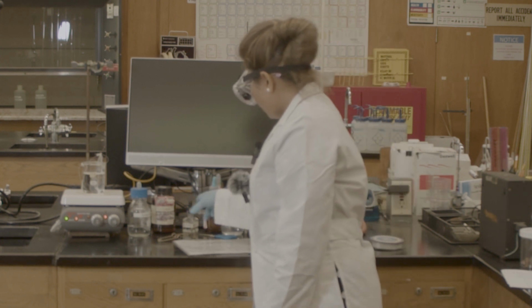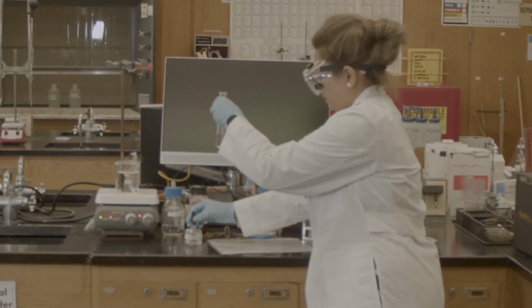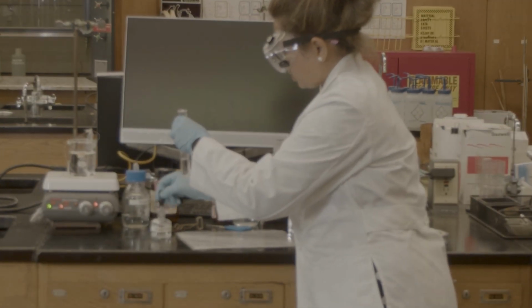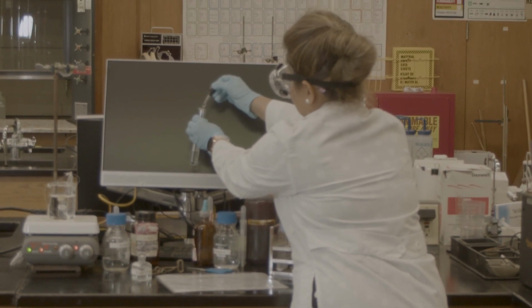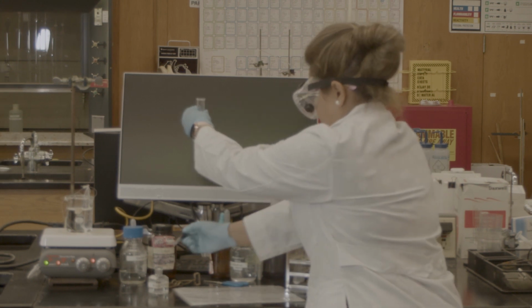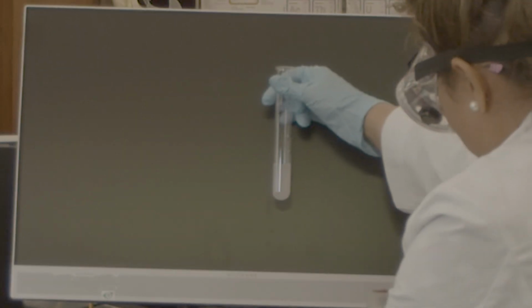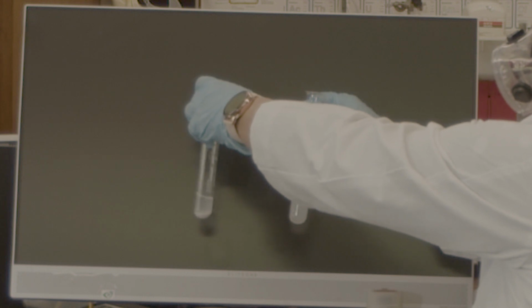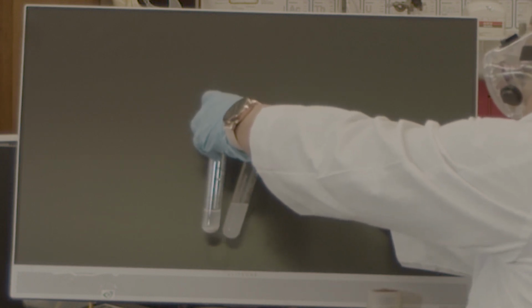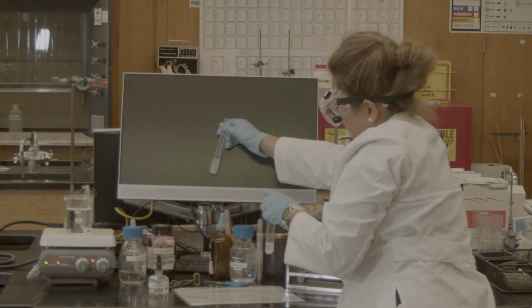Okay. So first thing I will do to check barium, I will use the sulfuric acid the same way. So barium. This is my solution from the jar. Okay. So I will use 5 drops of sulfuric acid. 1, 2, 3, 4, 5. Okay. As I told you, I expected less. So this is my true or this is my standard result in the test tube. And this is my barium. So I can see that there is barium inside. As this was clear and now it is white. Okay.